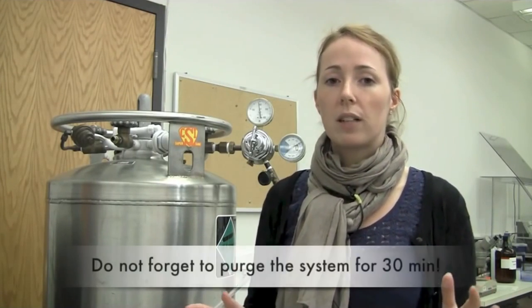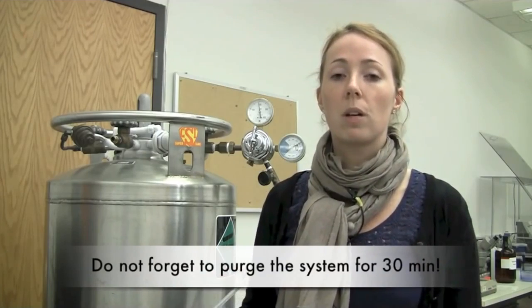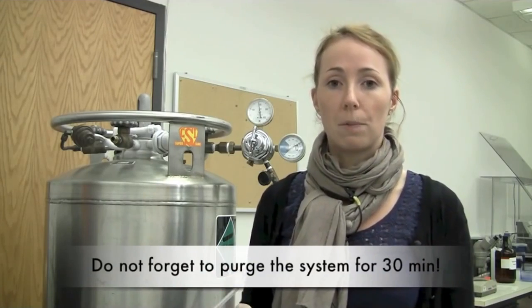Ozone is very dangerous and damaging for your respiratory system and in addition it's very damaging to the optics in the system as well. In top of that you have ozone and oxygen that absorbs light in the UV range. So to avoid all of these factors we always purge the system with nitrogen.